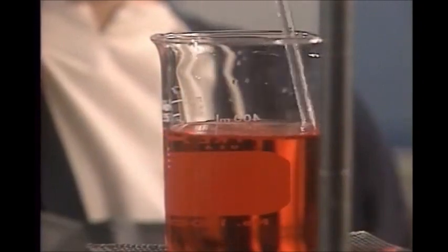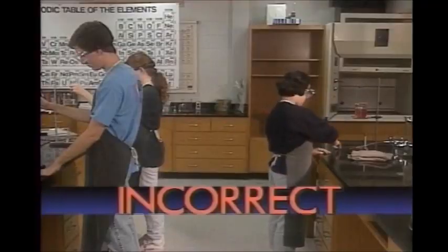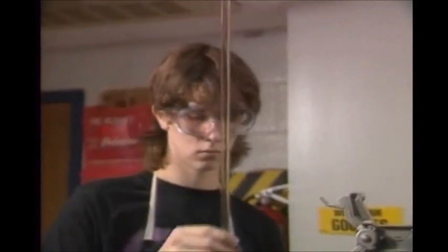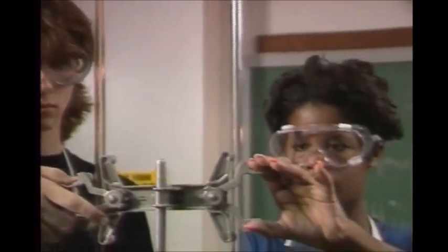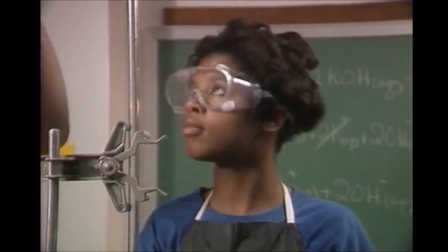A chemistry laboratory is full of beakers and bottles holding chemicals. Fooling around can have disastrous consequences. You could scar yourself or others for life, even cause blindness. So the most important rule of all in the lab is no fooling around. Don't run, push, or wrestle, or even move fast.